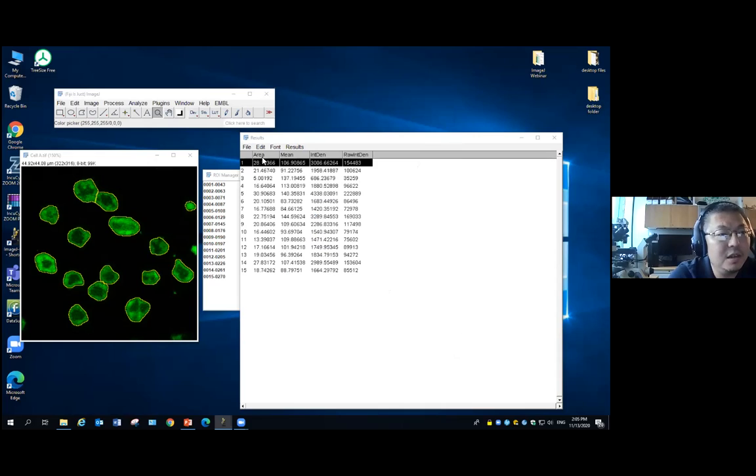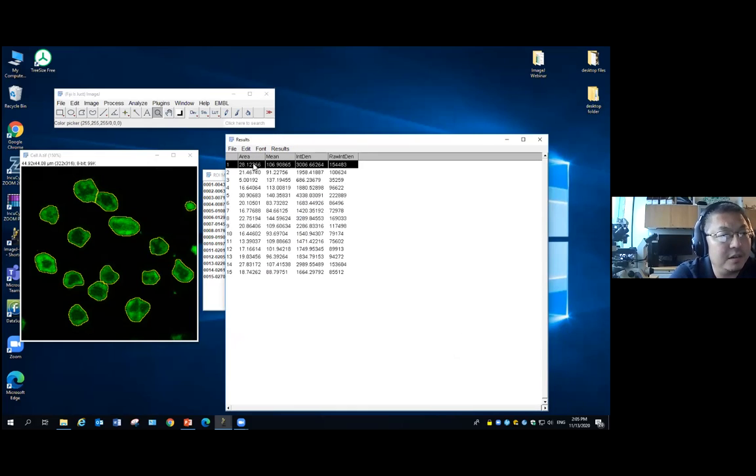So these are the parameters we asked it to measure: the size, the intensity, and the total intensity. When we're talking about these measurements, we know the intensity value is actually an arbitrary unit. There's no actual physical unit attached to it. It's just the intensity. Ideally, it means how many photons you receive. But the size, the area here, is actually attached to a physical unit. It can be meters, centimeters, millimeters, microns or nanometers.